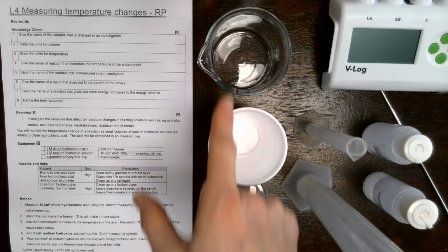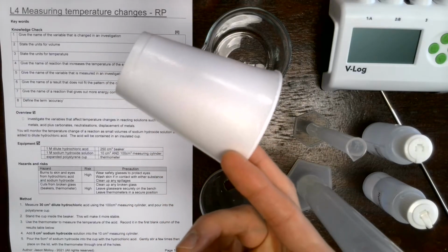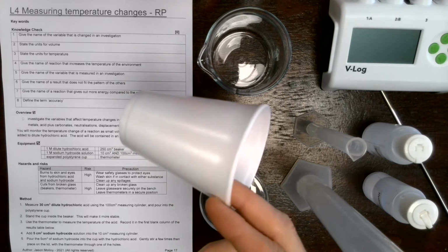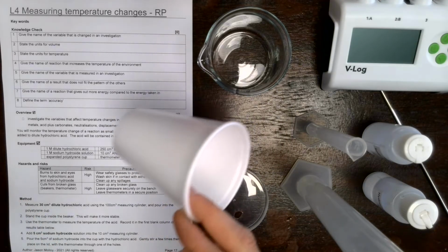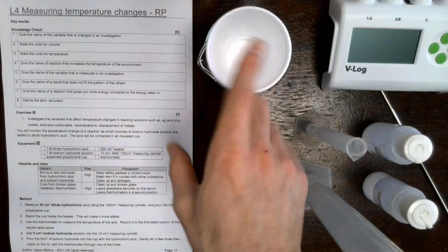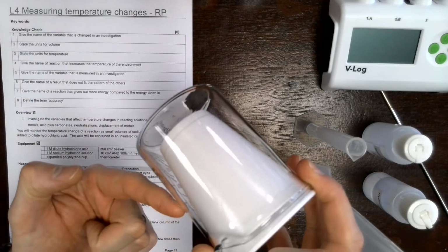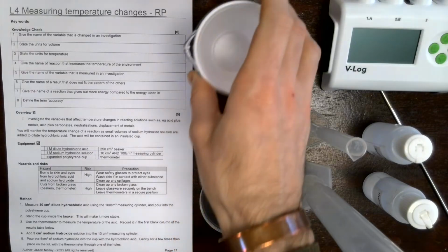We've got a beaker, which is going to be used to hold a polystyrene cup. The polystyrene cup is going to be useful because it is an insulating material, so any heat that is generated by the chemical reaction is not going to escape into the environment. It's going to stay within the solution, and we're going to get a more accurate measurement of what is actually happening during the reaction. So this is placed inside the beaker just because it supports and holds it nicely, stops it falling over. We could actually pack this with some cotton wool to create an even greater insulating layer around it as well, and that would improve the accuracy of this experiment.